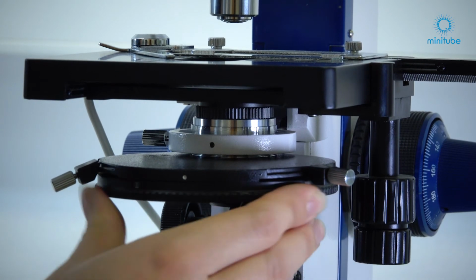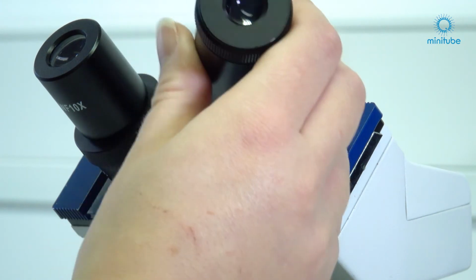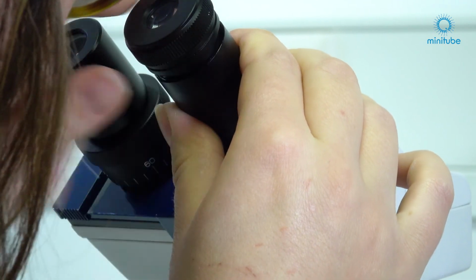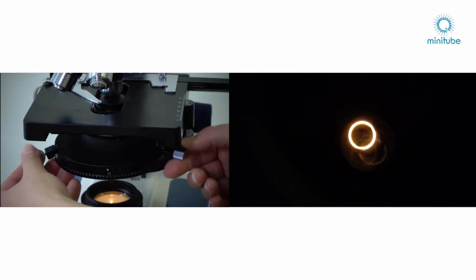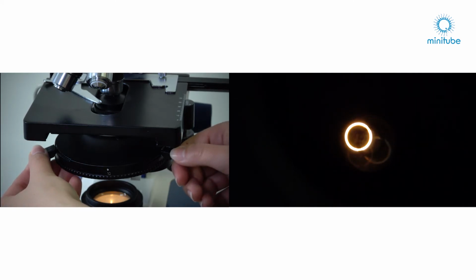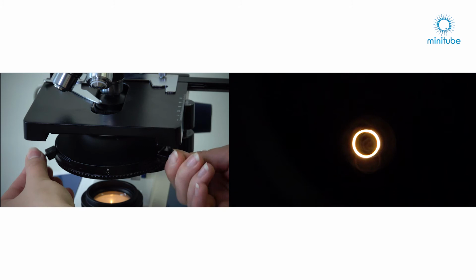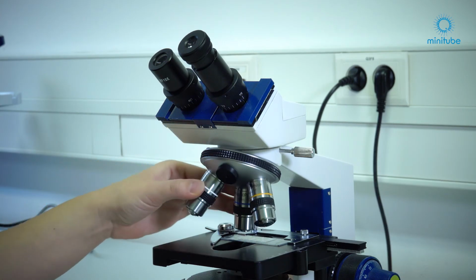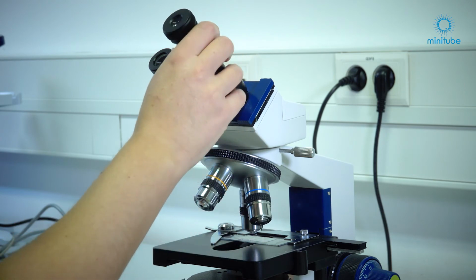to the same label. Remove an eyepiece from the tube and replace it with a centering telescope. Focus the phase rings by adjusting the eyepiece of the centering telescope accordingly. Use both centering knobs, which are located on the front of the condenser. Now you have to achieve a full overlap between the lighter annular diaphragm in the condenser and the darker phase ring of the objective. When done with this objective, repeat this procedure with every other phase contrast objective and then replace the auxiliary microscope with the regular eyepiece.